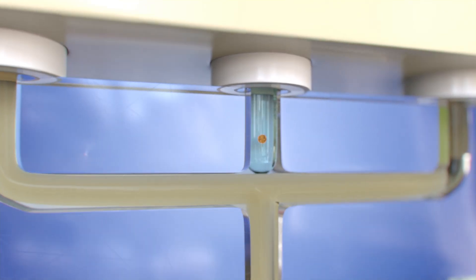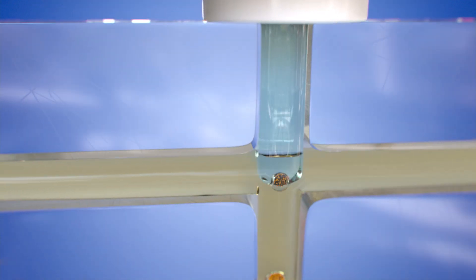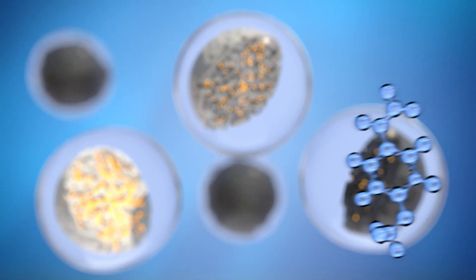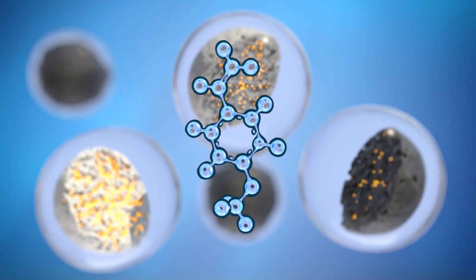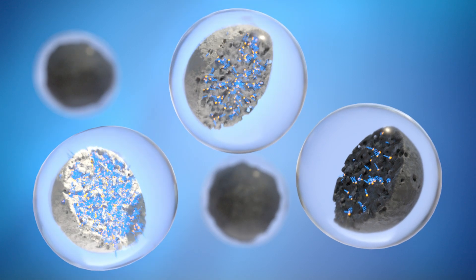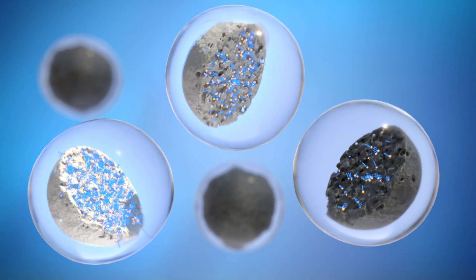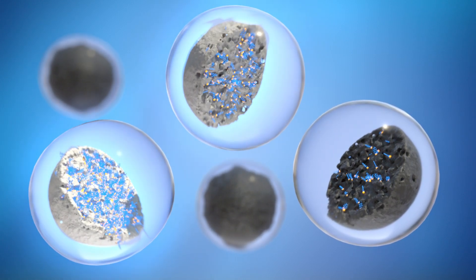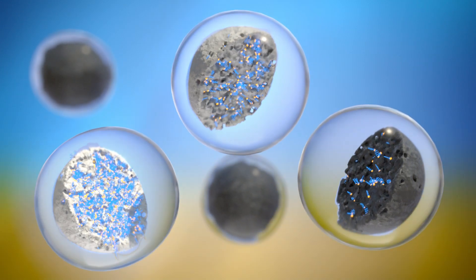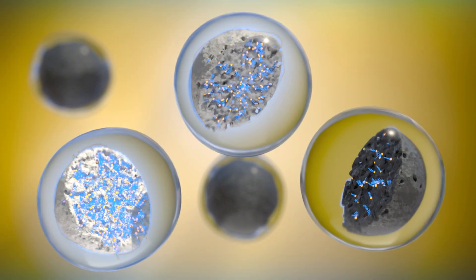In the microreactor, the particles are encapsulated in droplets. Catalyst particles are stained with styrene molecules. These molecules can oligomerise on zeolite acid sites to make fluorescent products. This fluorescent signal is thus linked to the acidity of a particle.